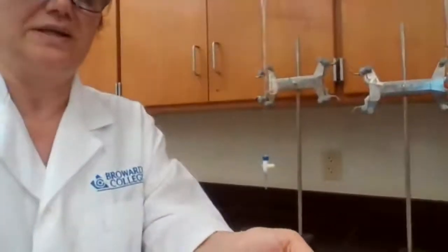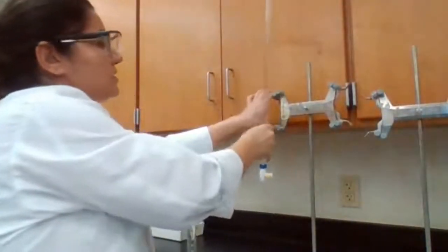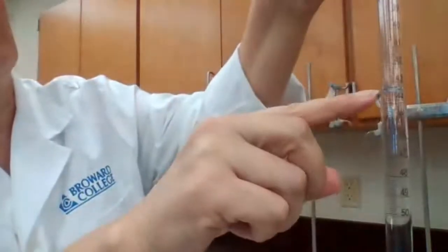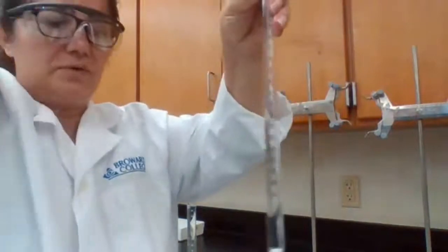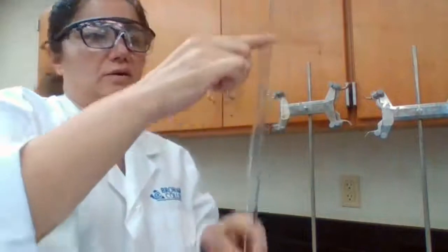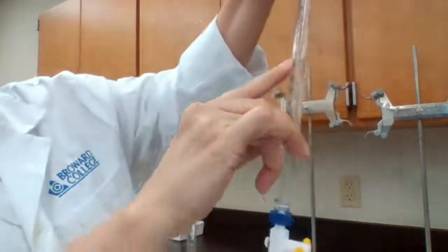Number 3 is the 3, 4, and 5. These are the volumes in the burette. Basically, when you are reading a burette, you are not reading how much liquid is in the burette. What you do is read the number on the burette, the level of the liquid in the burette. The numbers increase from top to bottom: you have 0 all the way at the top, and then 50 all the way at the bottom.